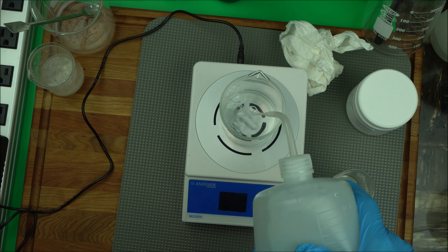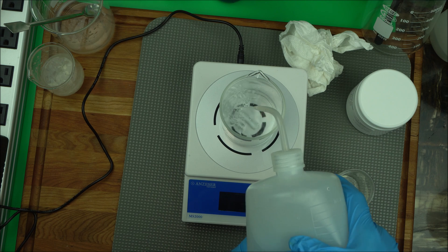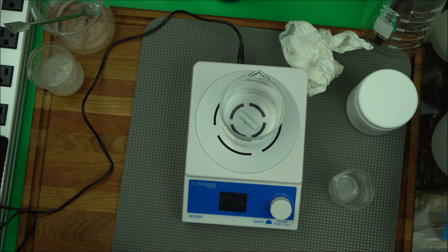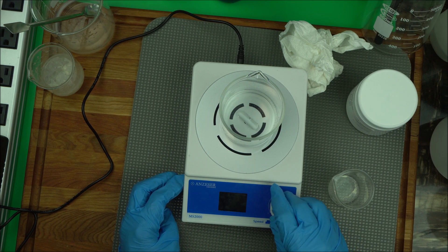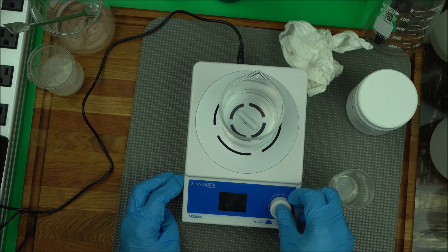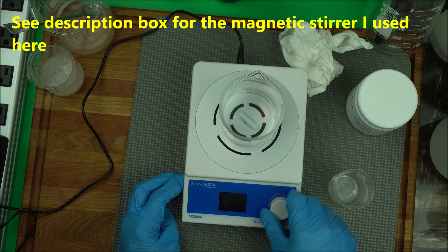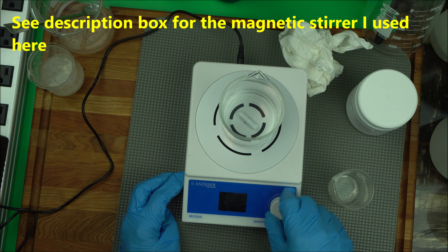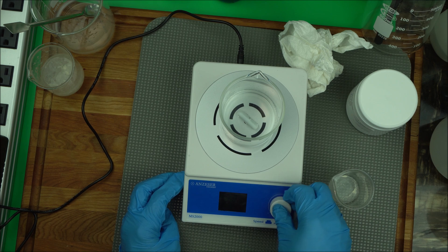I'm not giving a recipe for this, just showing you how to use a magnetic stirrer to better blend your gum. Then we're going to start our magnetic stirrer. I'm going to start at 1000 rpm. The rpm is the measure of the strength of the vortex. Vortex is the technology that really helps us blend well.